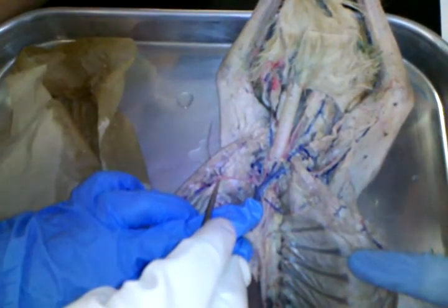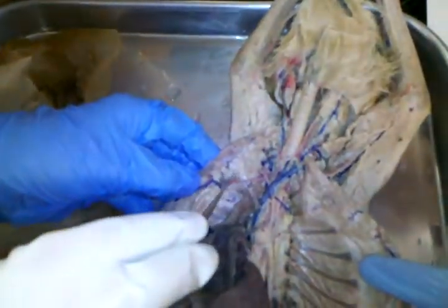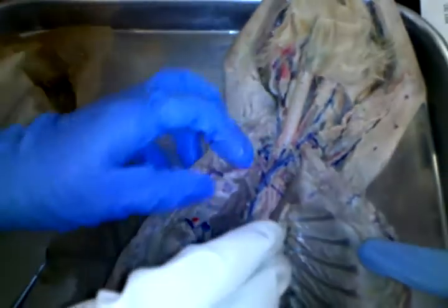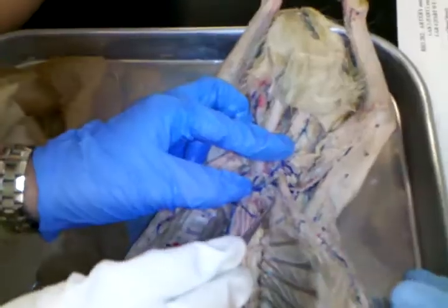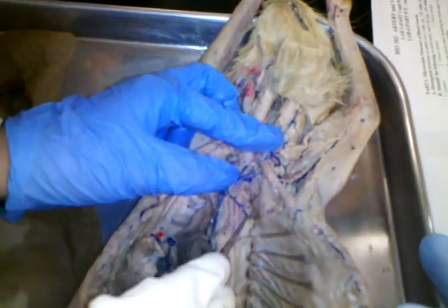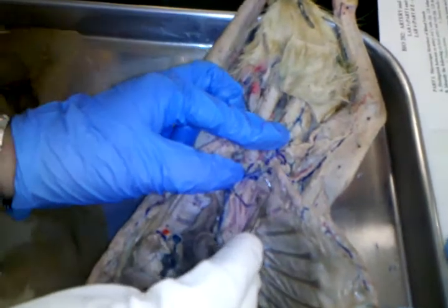Branching off of the subclavian on both sides, you have one that's called the internal mammary. You see how it would be going to the chest here? Okay, but it's on the inside, so that's where it gets its name. But you can see where it was following along here. I don't know if we can find it on this side or not. Oh, here it is coming off the subclavian on the left. Here's the left subclavian, and there's the mammary coming off there.